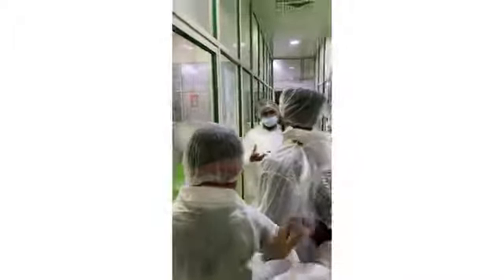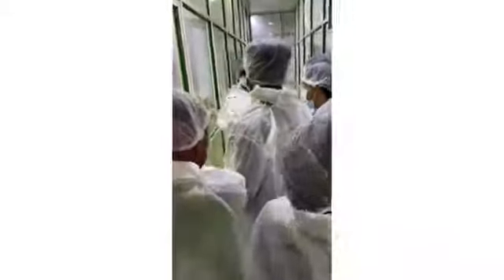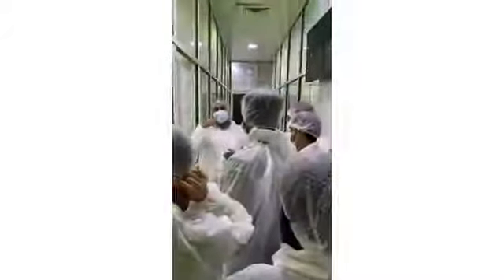Before adding the raw materials, the RO water equipment is analyzed. All the raw materials we analyze. We get clearance from the QC, QA, and micro departments. We have a store department, a microbiology department, a quality control department, and a quality assurance department. All those teams are in place. They analyze all the raw materials, and then they give clearance.